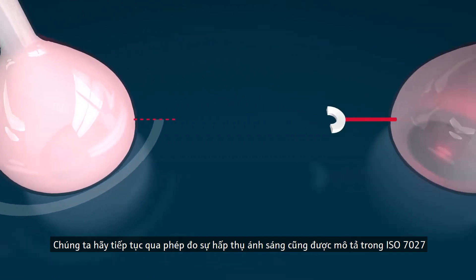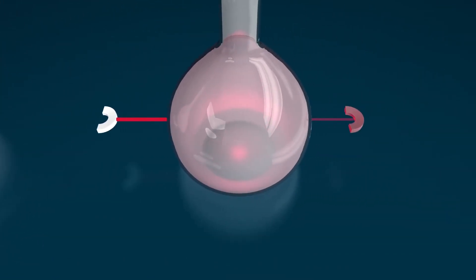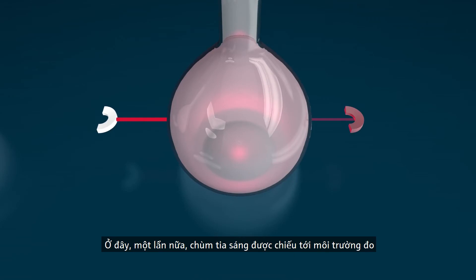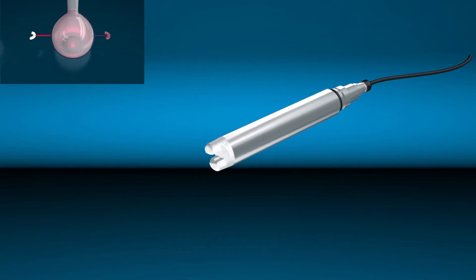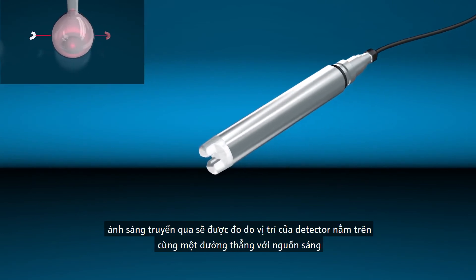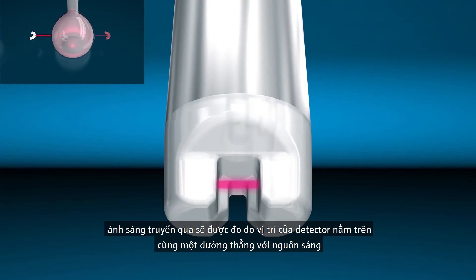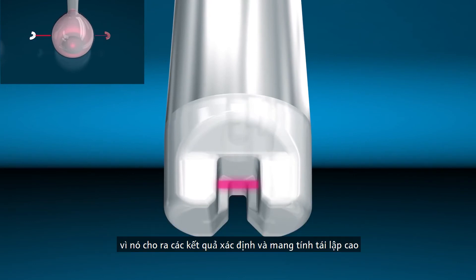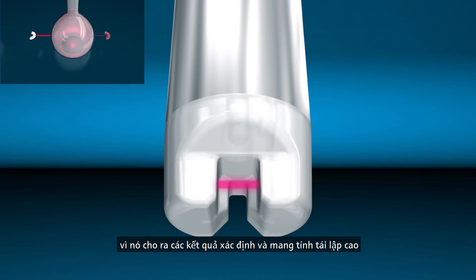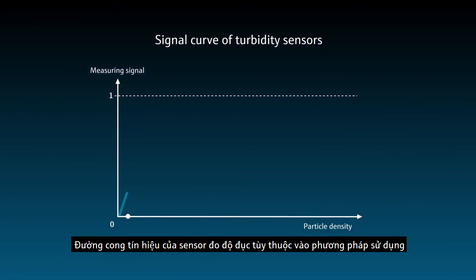Now let's take a look at attenuation measurement, also described in ISO 7027. Here, a light beam is radiated through the medium; however, in contrast to the scattered light methods, the transmitted light is measured because the detector is positioned in line with the light source. This method is suitable for average to high turbidity values, as it delivers definite results and offers high reproducibility.